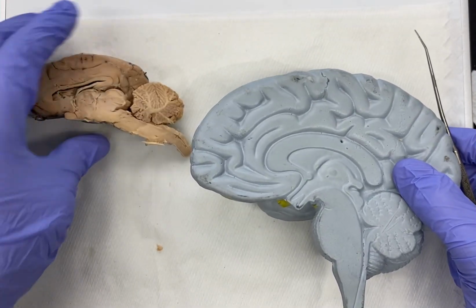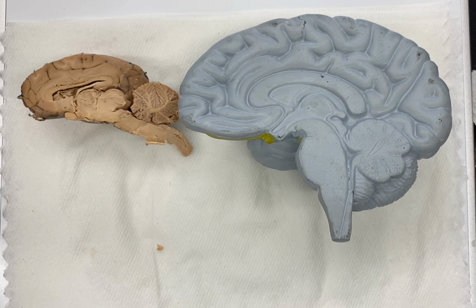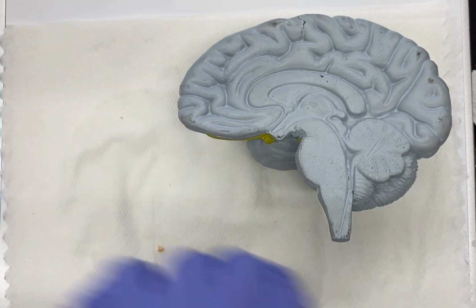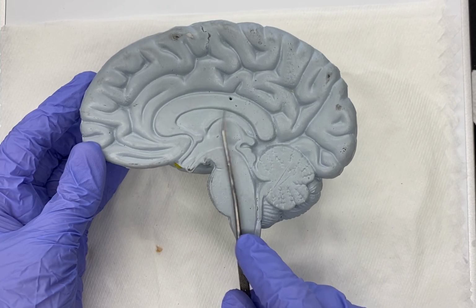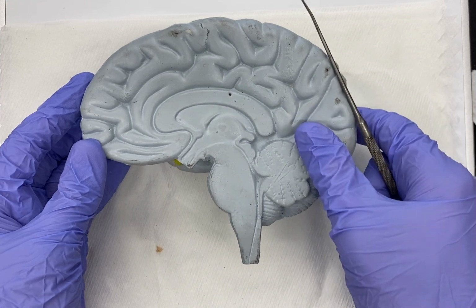I already alluded to this, but this is largely a reflection of our locomotion. How do these two animals move around? Humans, we're animals. How do we move around compared to, say, a sheep or any other four-legged animal, maybe another mammal in this case? So if we look at our human first, let me move this out of the way and show you our human brain. Picture this, and pay attention to where the brainstem is in relation to the brain. Remember, it's coming out the ventral surface, the underside, more vertically oriented.